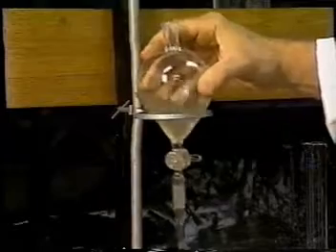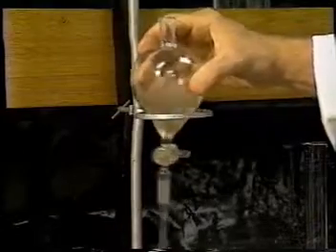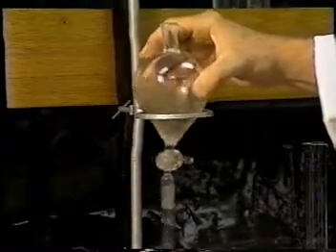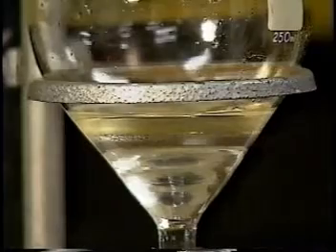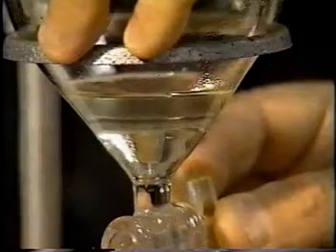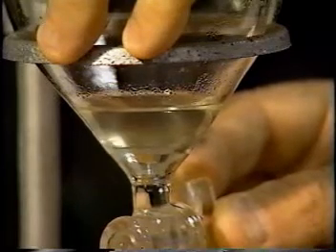What we're doing is using the fact that both of the reactants — the butanol and the ethanoic acid — are soluble in water, whereas the ester butyl ethanoate is insoluble, so it forms two layers. The excess reactants dissolve in water. Our ester, butyl ethanoate, is less dense than water so it floats on top; the aqueous layer is at the bottom, so we can carefully run it off.